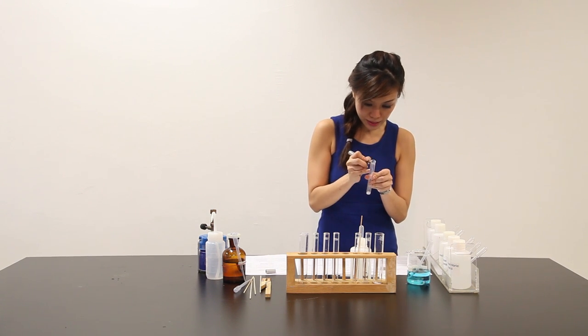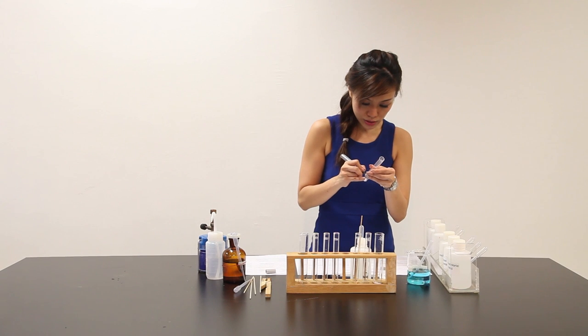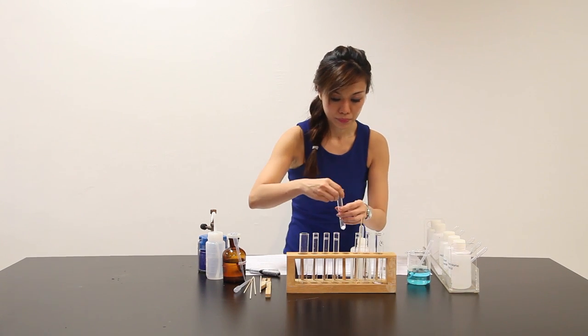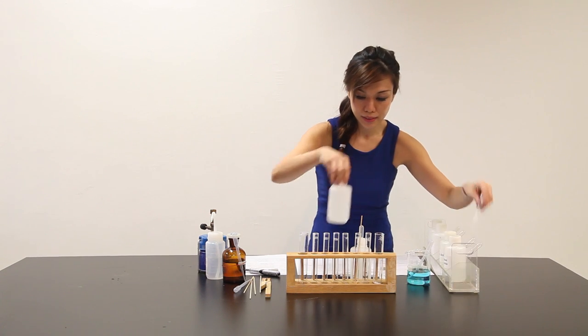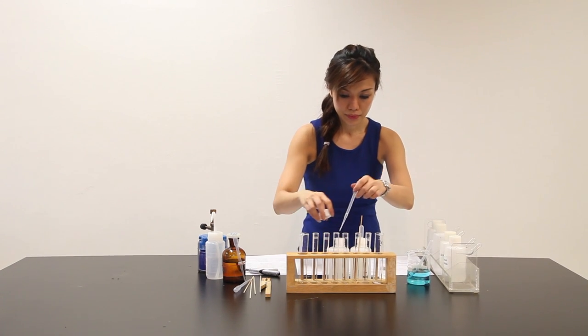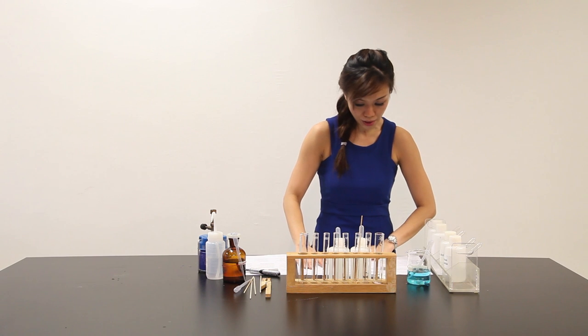Part C. HCl. Hydrochloric acid here. Alright.